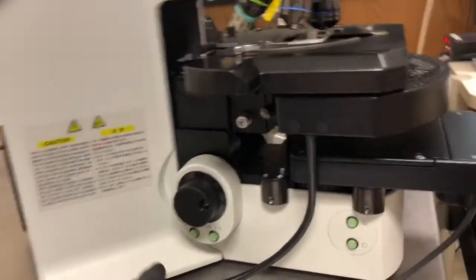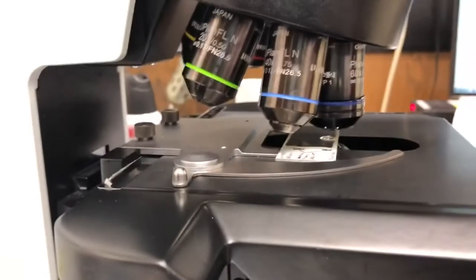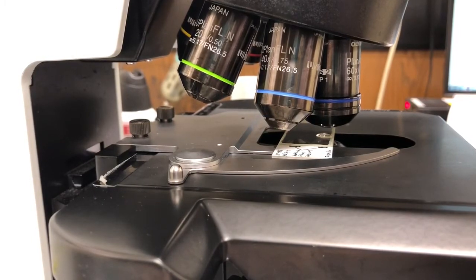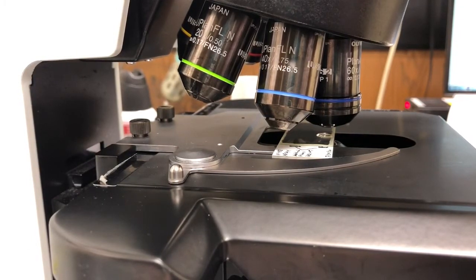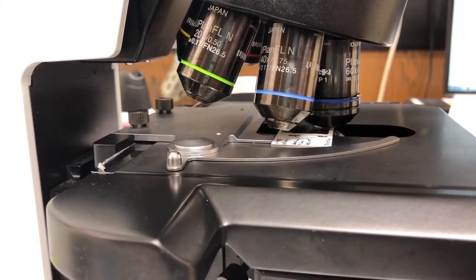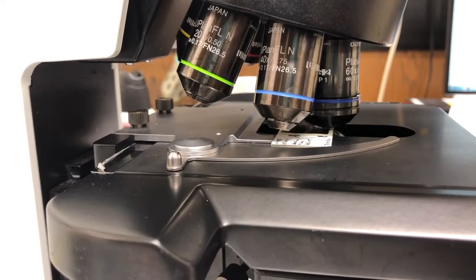So now if I press the escape button again, that's this one, the objective will move towards the sample and touch it. Now I won't crash into it because we were in focus at 40x and if you're in focus on one objective then the other one is going to be close to in focus. Let me do that so you can see, unfortunately we're kind of on the edge of the slide but that's just where this particular sample has something of interest.